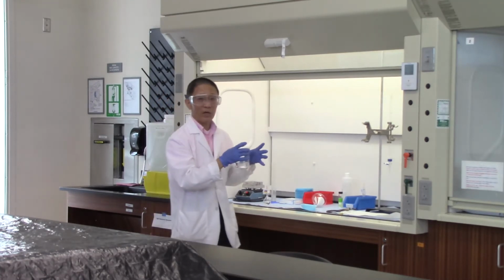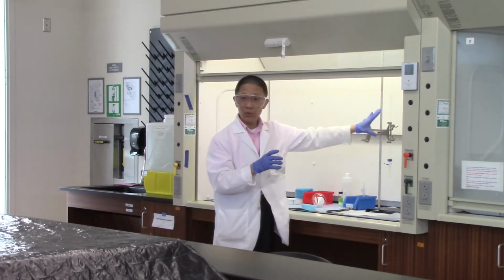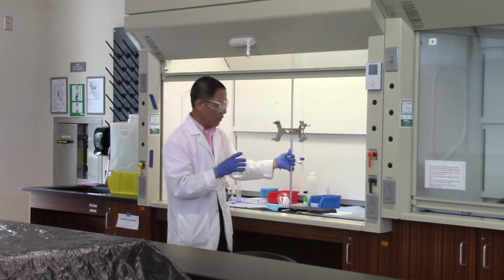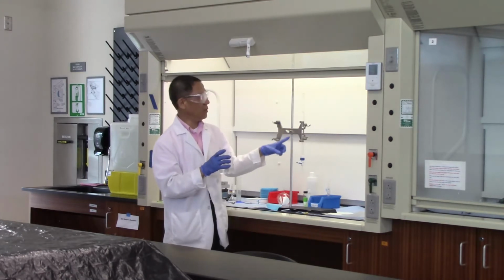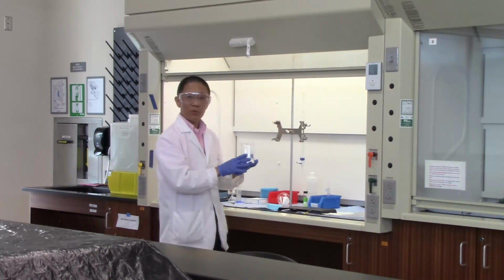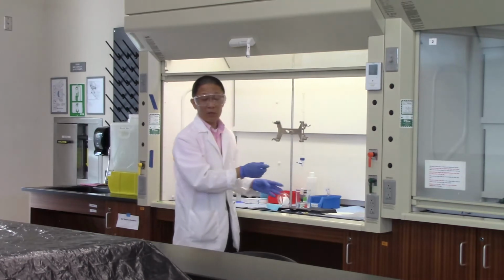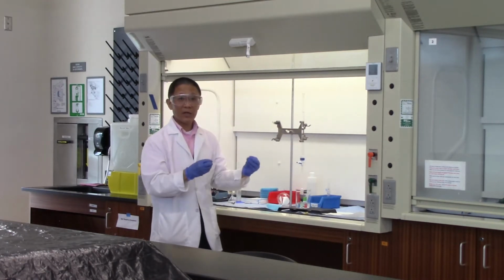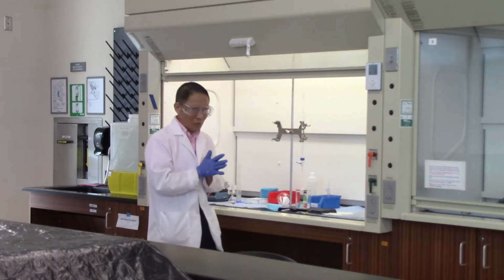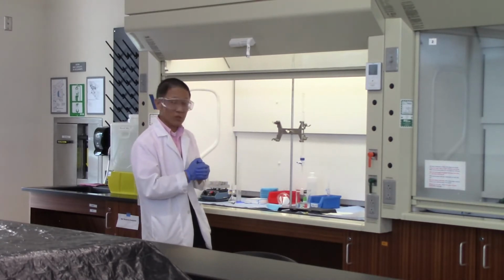And then the next part is adding barium chloride solution. Here we have a burette. We don't really have to use a burette, but the purpose of the burette is that we can accurately measure the amount of barium chloride into the beaker. All of the sample is dissolved, and then we're ready to add the barium chloride. The lab manual asks you to add barium chloride slowly to the boiling solution. For demonstration purposes, we're not going to set up the hot plate or Bunsen burner to keep the water solution boiling.